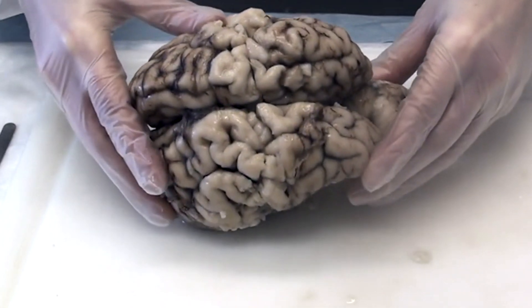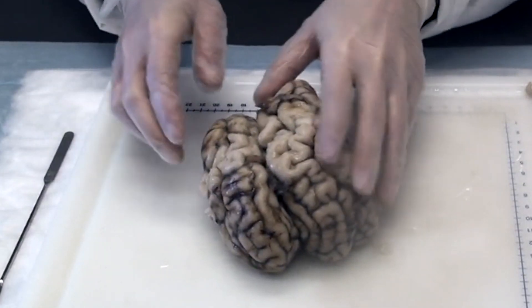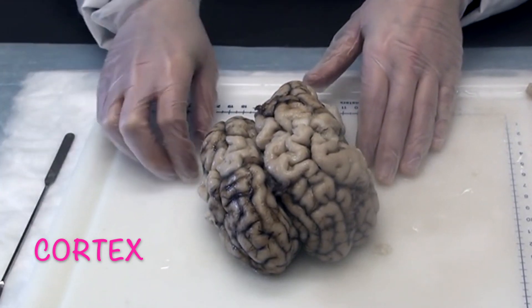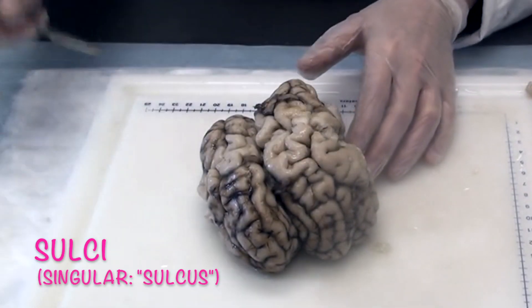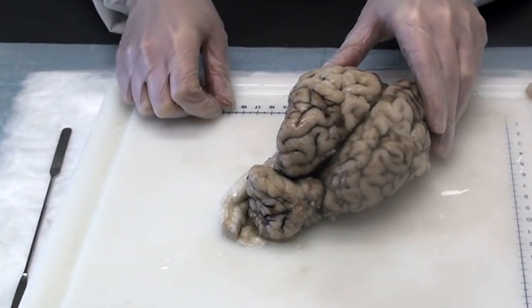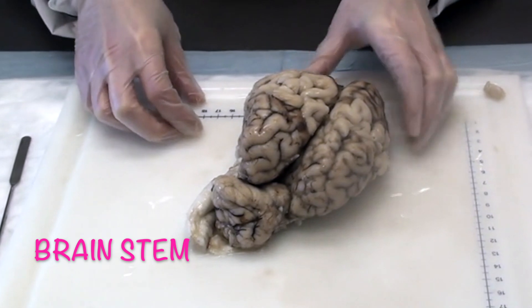Looking at the brain from above, we can see the dorsal or top view. This is the front or rostral end, and this is the back or caudal end. You can see two halves of the brain, which are called the cerebral hemispheres. The outer layer of the cerebral hemispheres — the part you can see now — is called the cortex. The cortex is covered in bumps called gyri and grooves called sulci. The different bumps and grooves divide up the cortex into different parts of the brain called lobes. Here at the back you can see the cerebellum, which means 'little brain' — it's called that because it looks like a small version of the whole brain. The cerebellum helps control movement. You can also see a little bit of the brain stem, which connects the brain to the spinal cord.